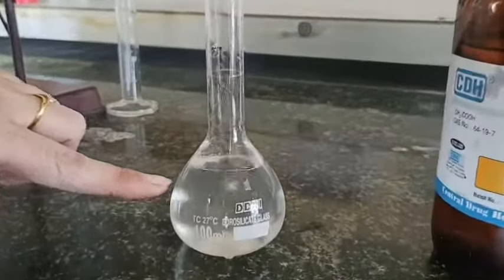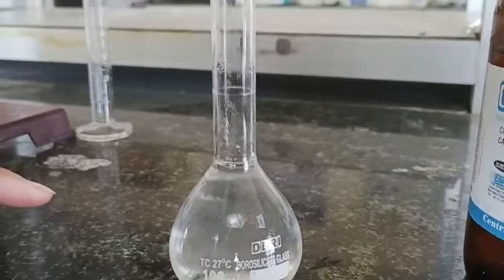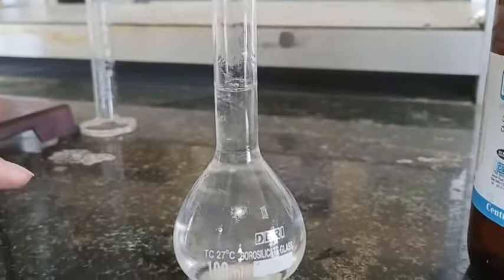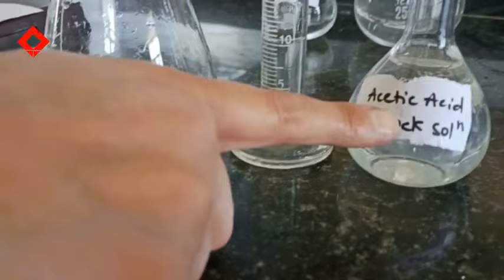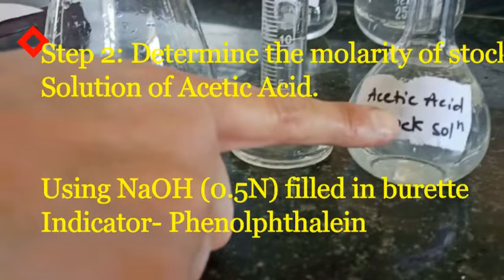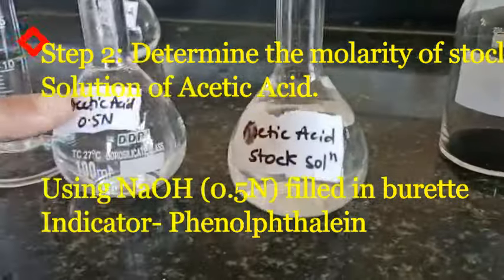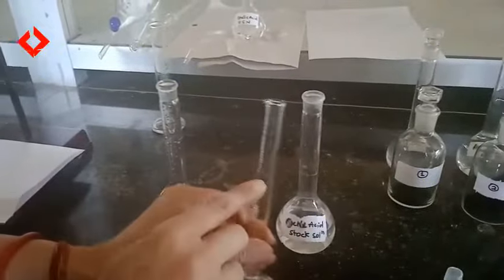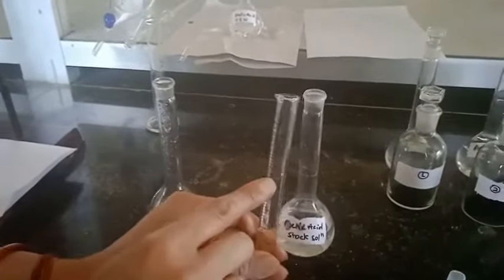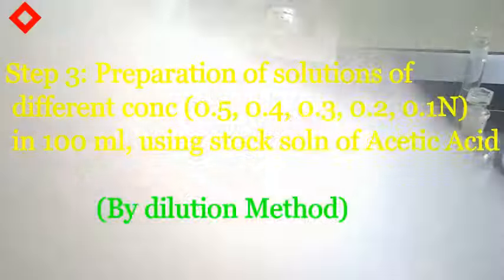The second step is to determine its concentration. We are going to determine the concentration of acetic acid by titration against a standard NaOH solution using phenolphthalein as an indicator. I have done this in my previous video — you can go and check.